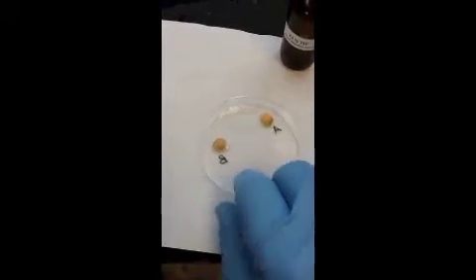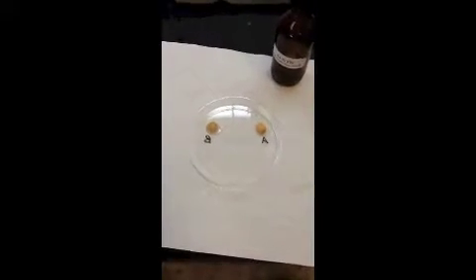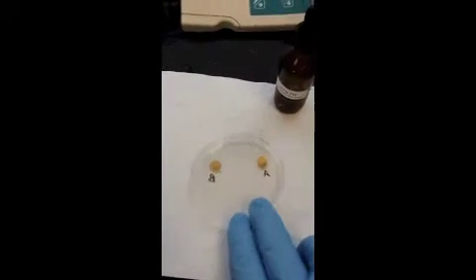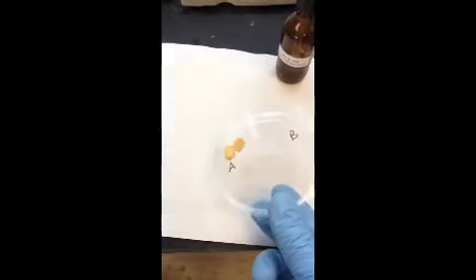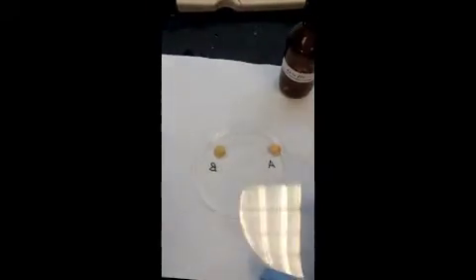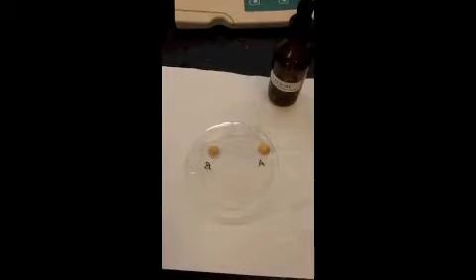Okay. So you see one is labeled A, one is labeled B, and so from time to time we're going to come back in and check in on whether or not there's a difference between the two. Just as a quick test, we're going to flip these over and take a look at the color as it is now. Okay. You can see no color development, and I'll rearrange B, put it back in its spot. Okay, and we'll check back in on it in about 15 minutes.